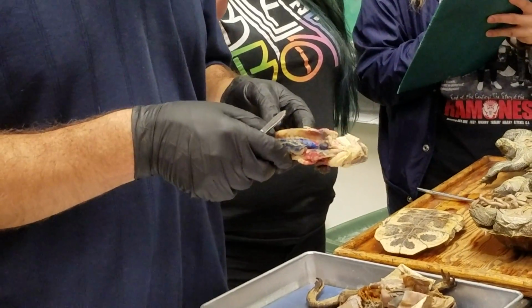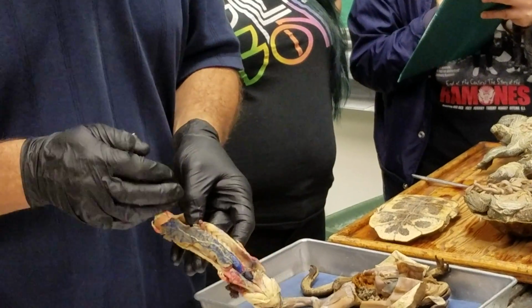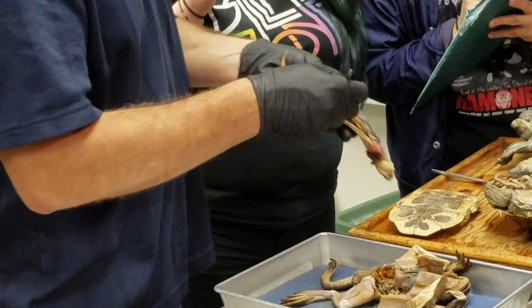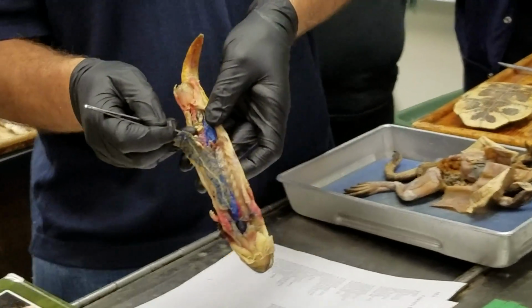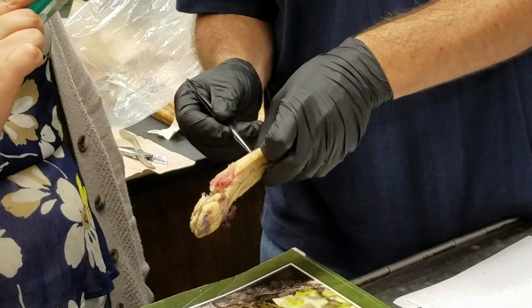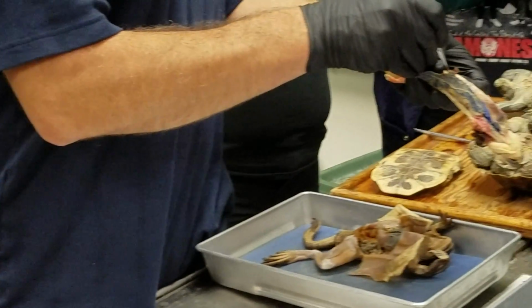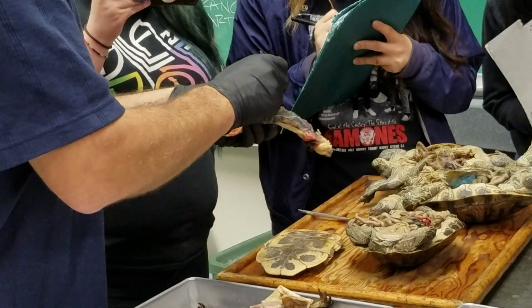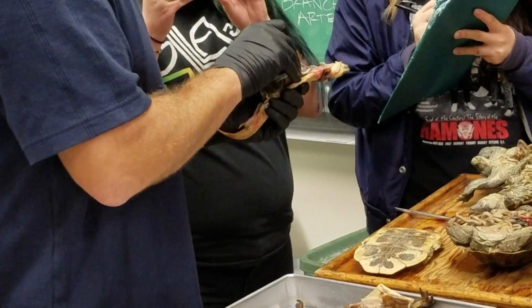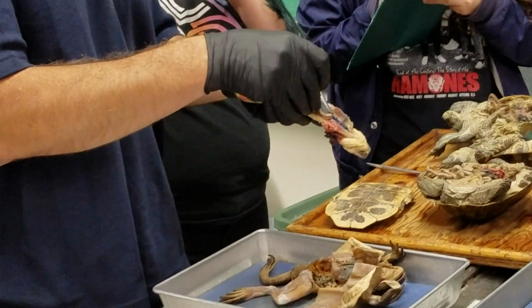Caudal vena cava is the biggest vessel in the venous system of these guys, and it lies posteriorly right between the two kidneys, right in the midline. So that's the caudal vena cava there. And then it runs ventrally into the liver like that. So you can see it running into the liver. And then it's going to run through the liver and pop out again here at the front end of the liver and run up to the hepatic sinuses into the heart. So that's it right there.